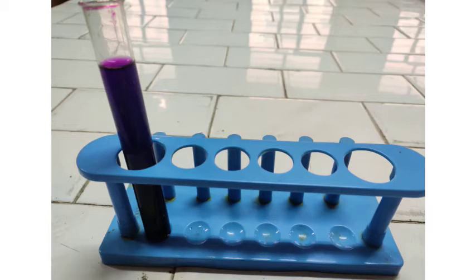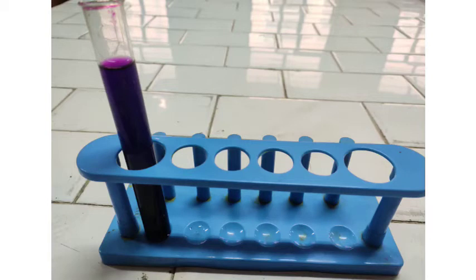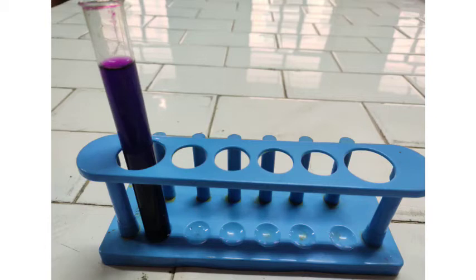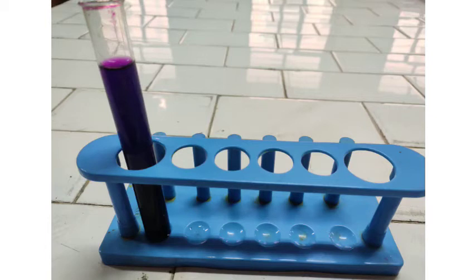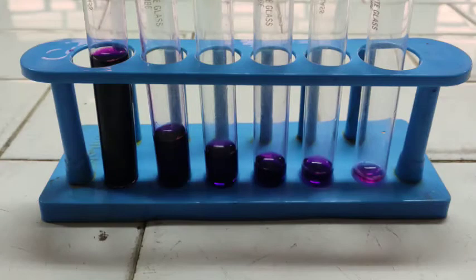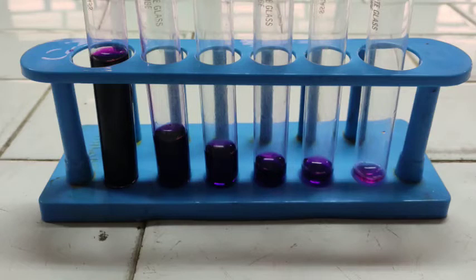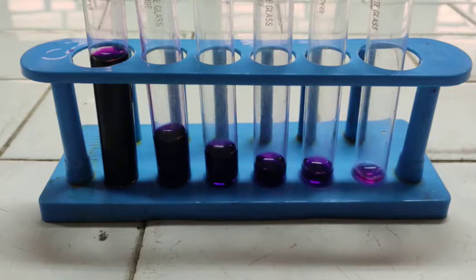First of all, we will pick a standard solution of potassium permanganate — you may have any concentration but not high concentration. You may take 100 ppm or 200 ppm. Then we will take 1, 2, 3, 4, 5 ml of this stock solution into five different test tubes so that we can get different concentrations of five different solutions of potassium permanganate.